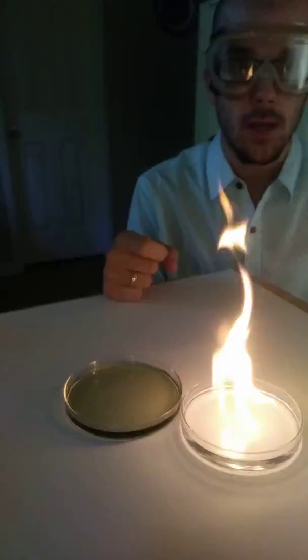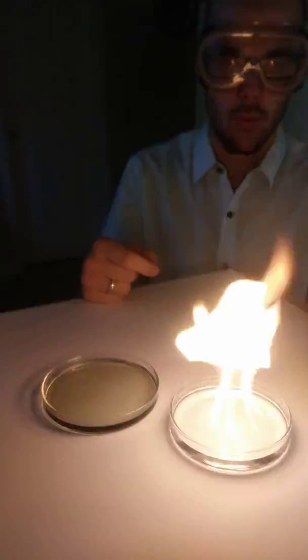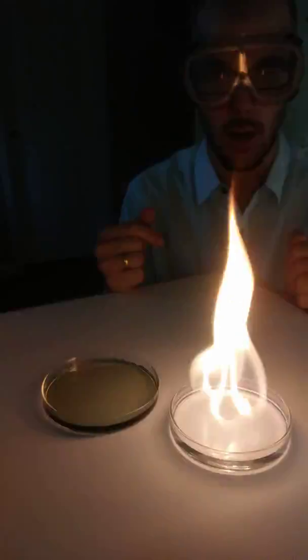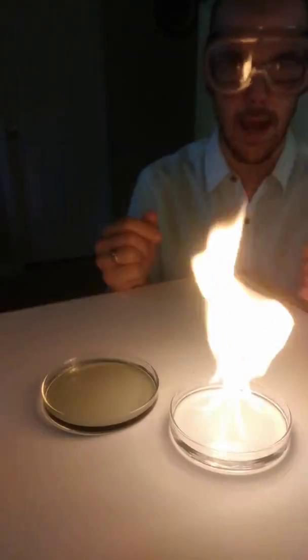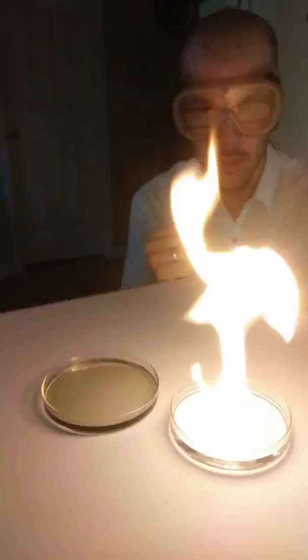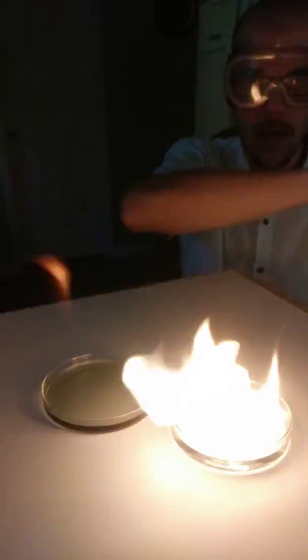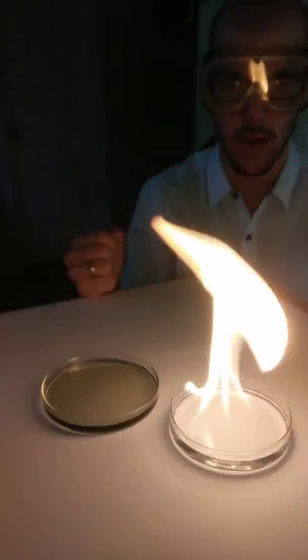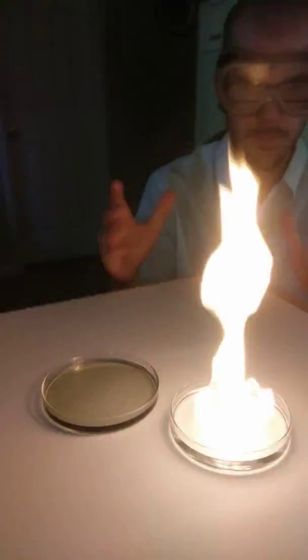There are a bunch of things we can observe right now as we're looking at this demonstration. The most obvious one is there's a lot of light being thrown off — brightness, light, energy. I can feel the flame from all the way over here, and if I pass my hand over it there's a huge amount of heat coming off that flame.